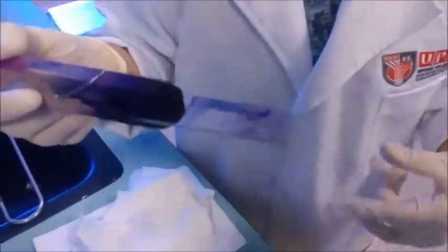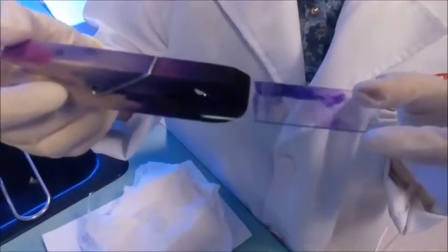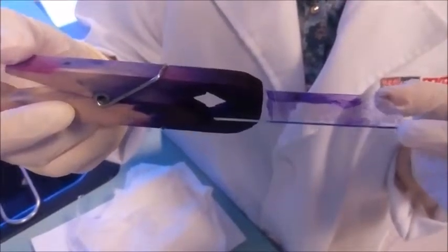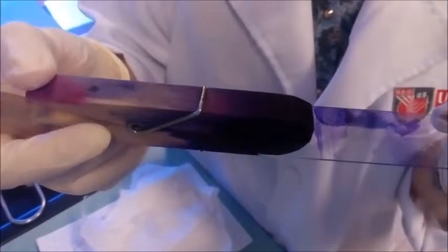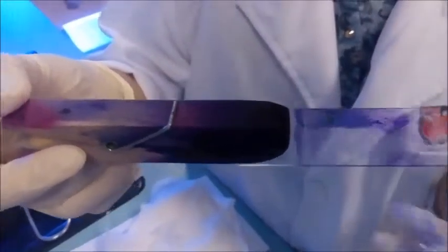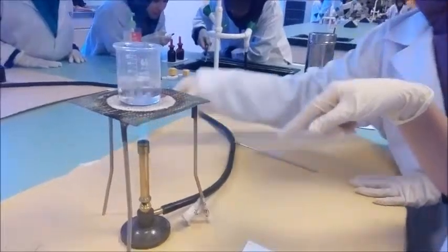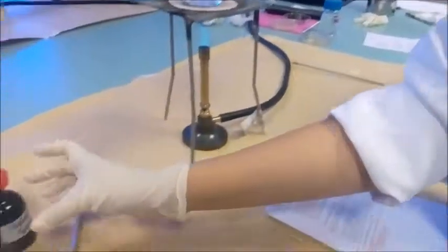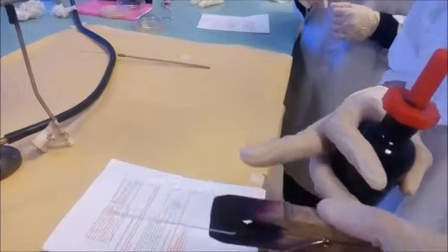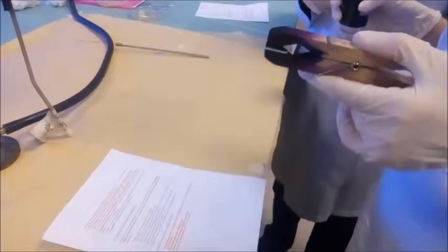Oh, okay, faham. And then place a cover slide and observe it under the microscope with a magnification of 45. Okay, for the other step, we're going to follow the other step. We have prepared a beaker containing water and let it boil. So next, place a few drops of malachite green over the slide.